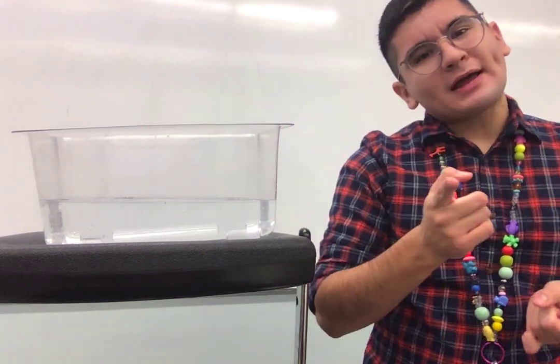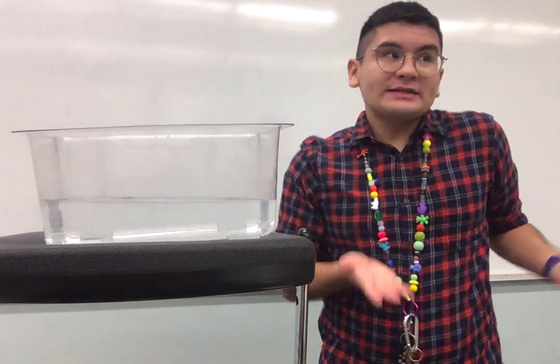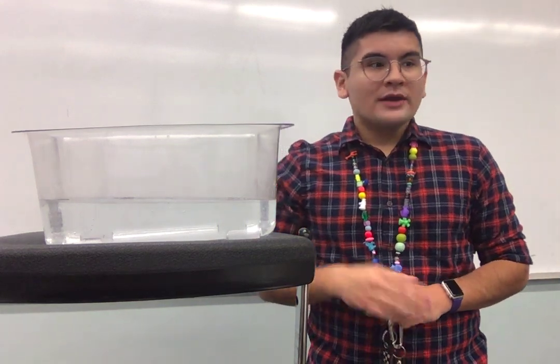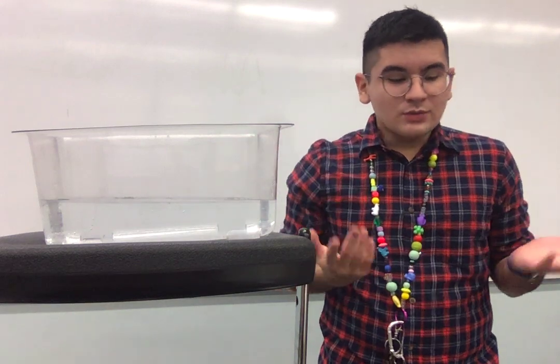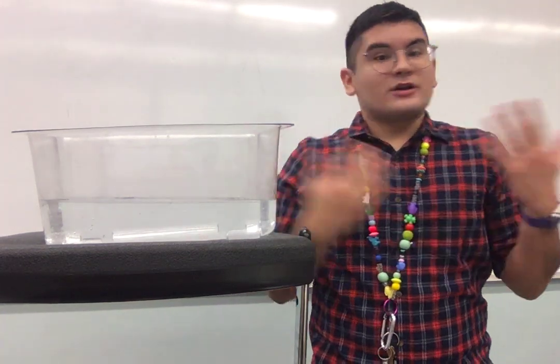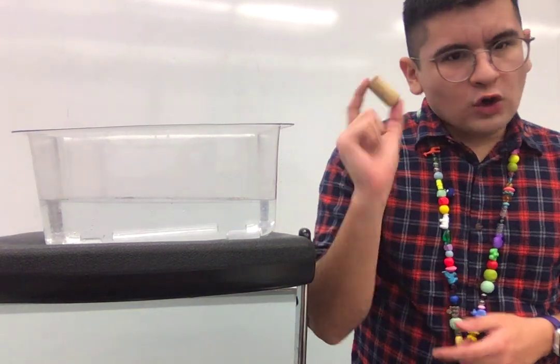Now if you remember correctly, solubility refers to if something dissolves or it doesn't. So if I say, for example, something is soluble, I mean that it dissolves, okay? If something is not soluble, it does not dissolve. So what we're going to be doing today is testing this theory. We're going to see if some items are soluble and if some items are not soluble. So let's get started. We're going to start off with a cork.